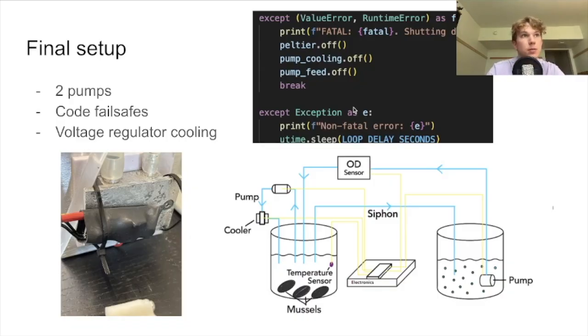Furthermore, we have many double layer concepts with the styrofoam box and the OD sensor shoe box to remove the water risk. We ended up using 2 pumps, since this would be the best solution for temperature control. We still have a siphon from the mussel bucket to the algae bucket, which removes 1 pump from the system.